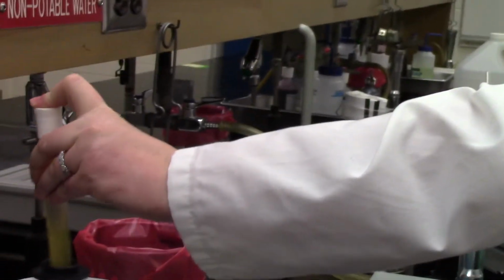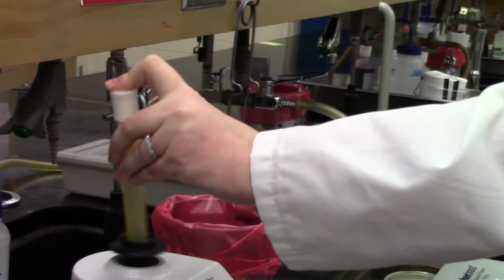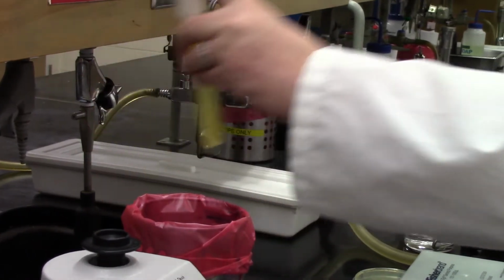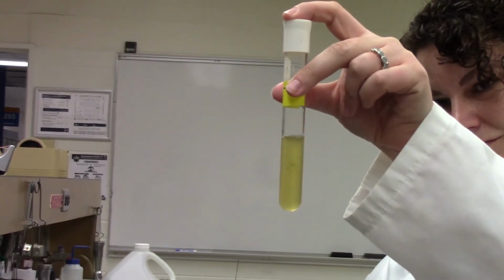Now she's got a lovely diluted solution of plant juice, and there it is getting vortexed so that it's really, really well mixed. It is always a little funny doing these because there's usually a few chunks and things that you normally wouldn't see in a typical sample, but there it is. You can see the effect of the dilution.